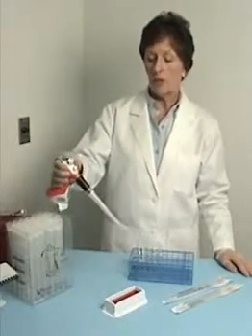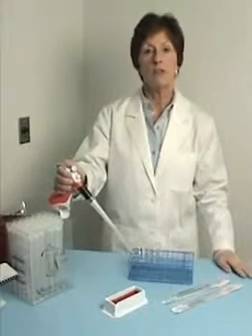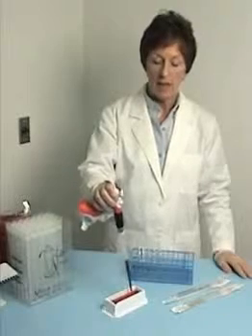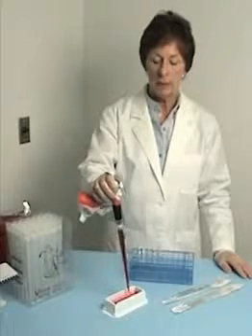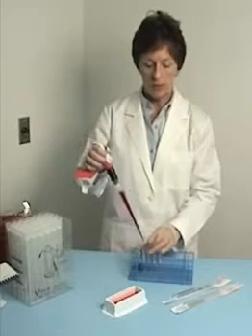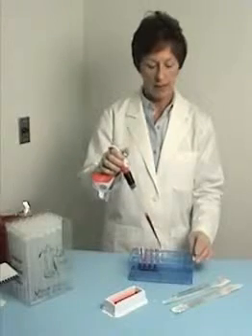In either case, generally you're pipetting large volumes. Today I'm going to show you the multi-dispense feature, so that if you have a row of tubes to fill up, you can see how easy it is. I have the pipette set in the multi-dispense function and I am now about to dispense 2 mLs into each of the tubes on my rack.